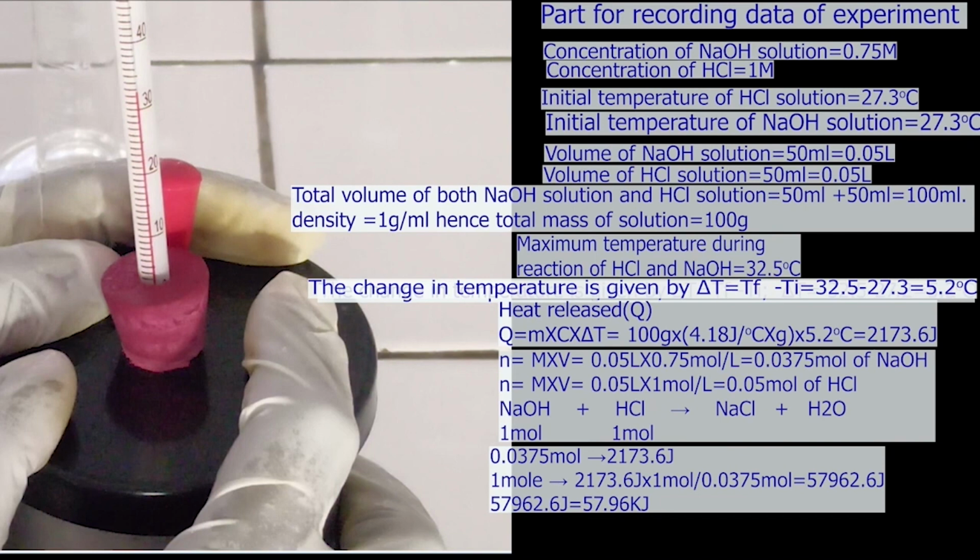In this experiment, mole of sodium hydroxide isn't equal to mole of hydrochloric acid. Hydrochloric acid is the excess reagent while sodium hydroxide is the limiting reagent. For calculating enthalpy of neutralization, the heat released by 1 mole, we have to use the limiting reagent, sodium hydroxide.